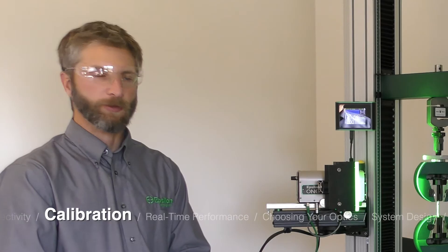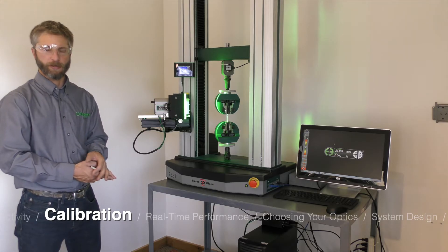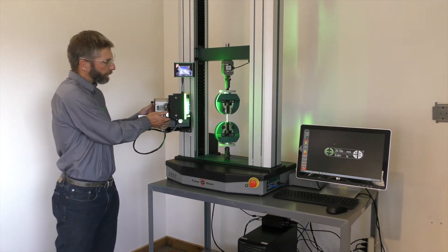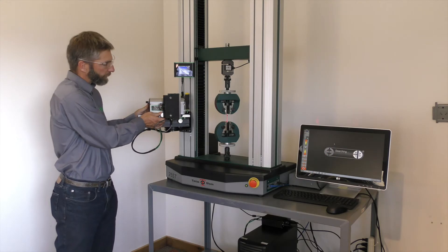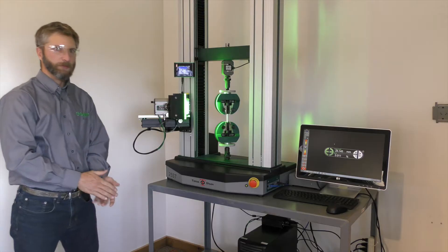The optical calibration of Epsilon-1 has already been performed at the factory. No grids and bars are necessary during the installation process. Simply set the appropriate working distance using the alignment feature onto your specimen. The system is now calibrated and ready to test.